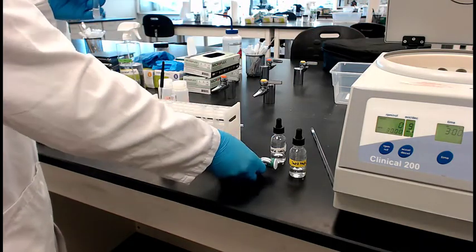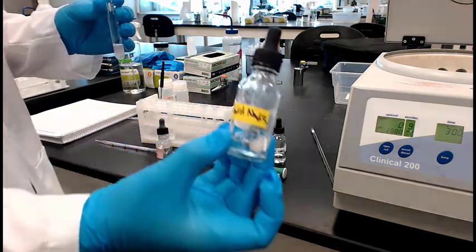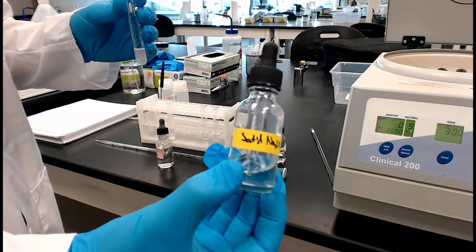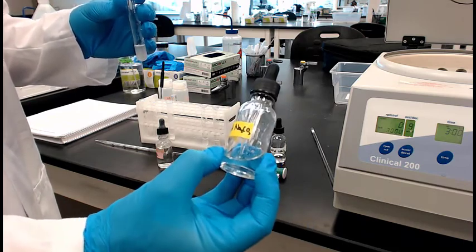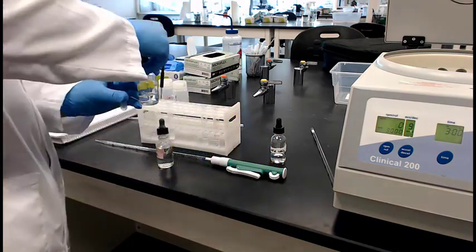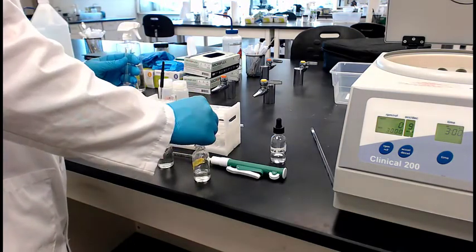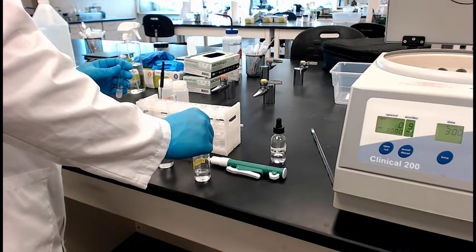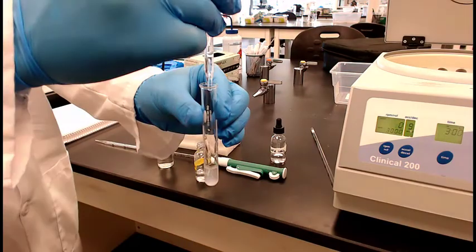And now what he's going to do is he's going to work on this step 6. Yep. That's a saturated sodium carbonate. All right, saturated sodium carbonate, and he's going to add that to the tube. This is step 6. And again, look at your balanced reaction, see what happens here. Add some of that.